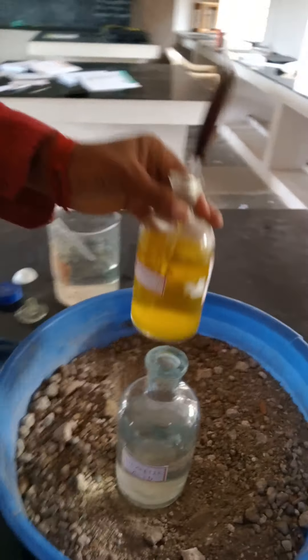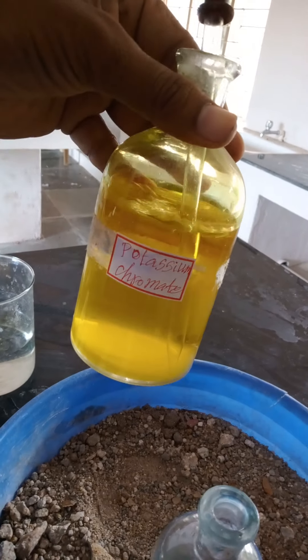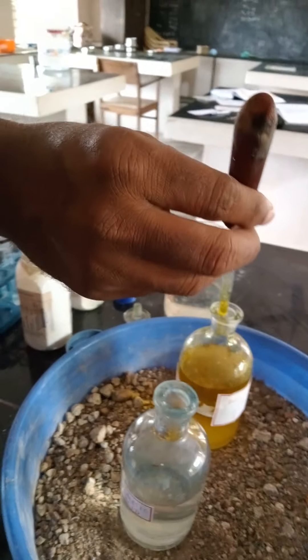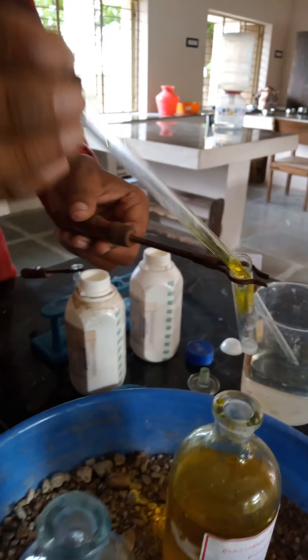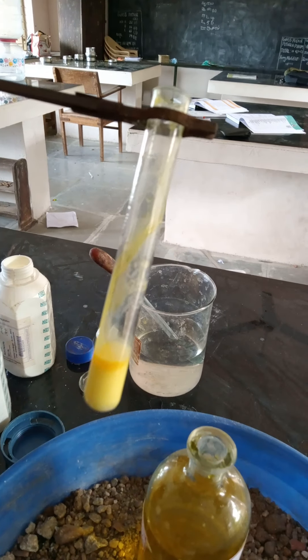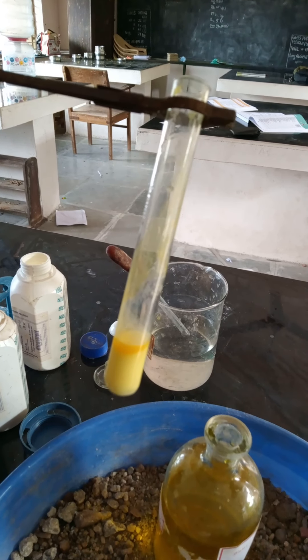Now add the potassium chromate solution in all four test tubes. In the first test tube — barium chloride — add the potassium chromate. A yellow color precipitate is formed, which indicates confirmation of barium.